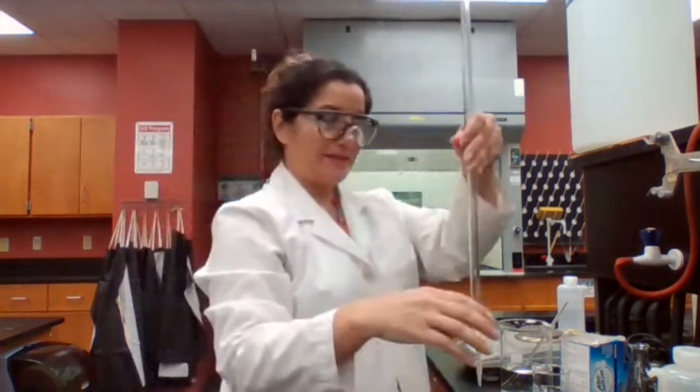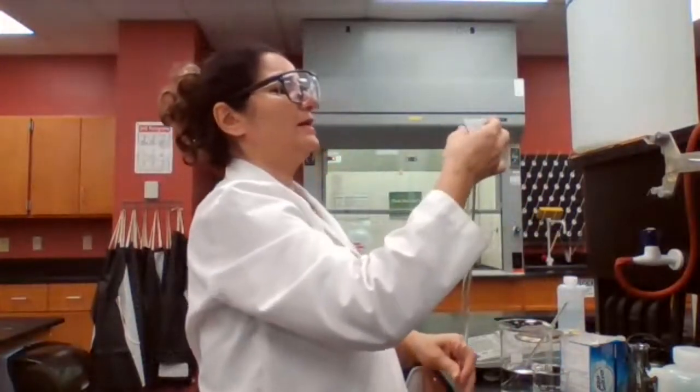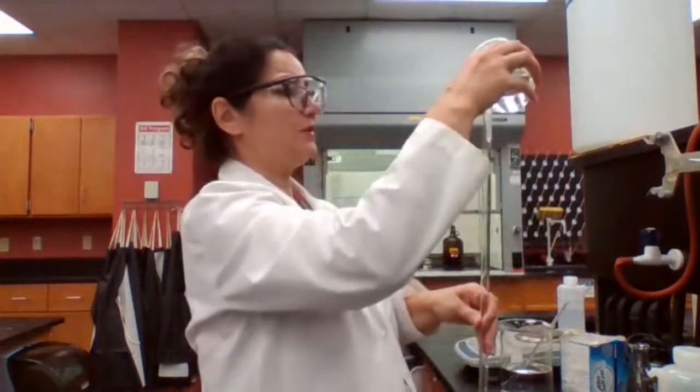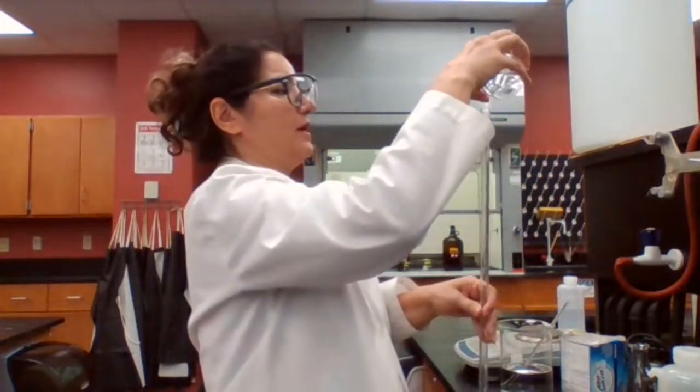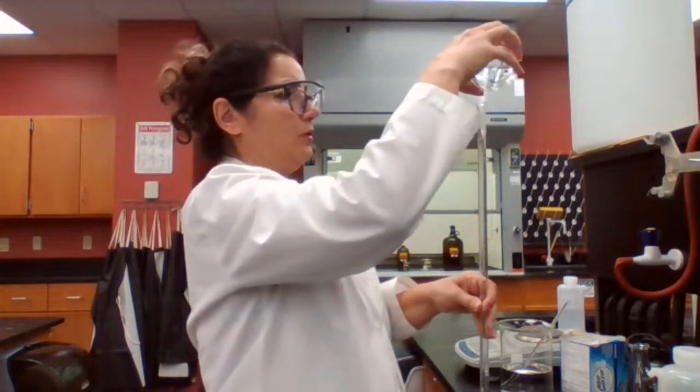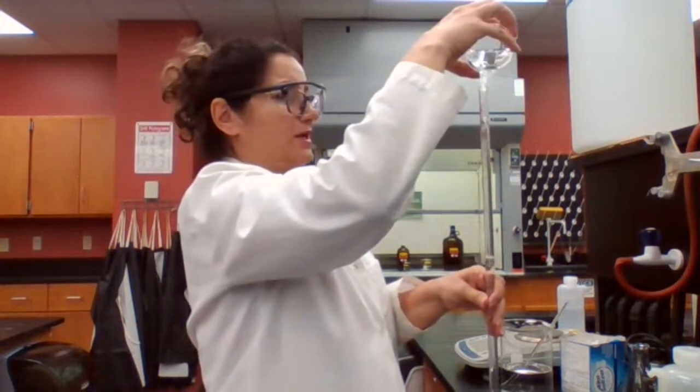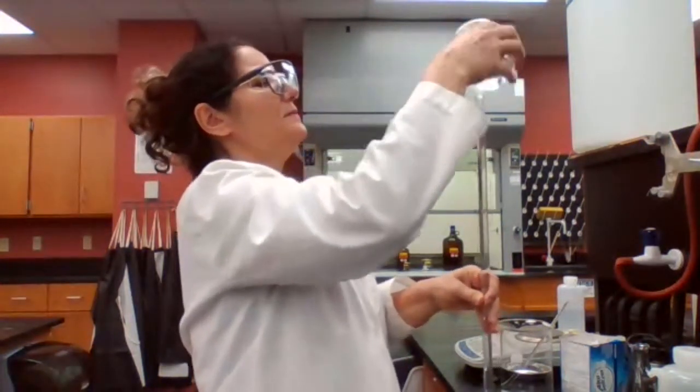My burette is ready to be used. I washed it with deionized water and rinsed it with sodium hydroxide. I'm always going to rinse it with the same solution that I'm going to fill it up with. I'm holding the burette so you can see it better; otherwise, this needs to be secured on the burette clamp.